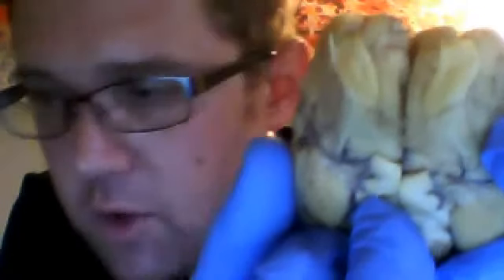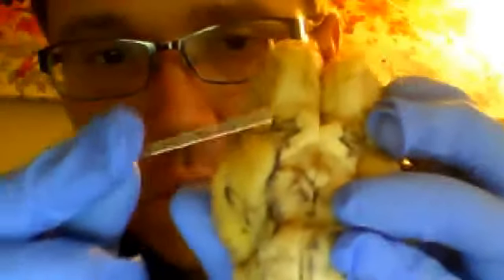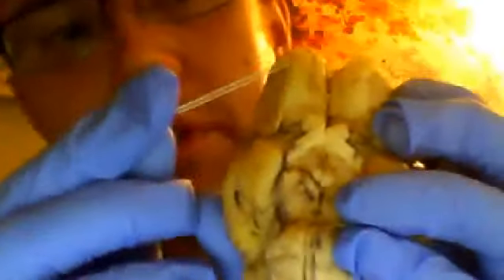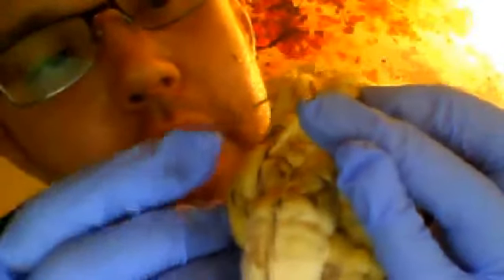These right here are the olfactory bulbs. The olfactory bulbs descend into an olfactory tract. Let me see if I can get my pen to trace that a little bit for you. So the olfactory tract, which goes from the olfactory bulb down, and there you are. You have the olfactory bulb and the olfactory tract.